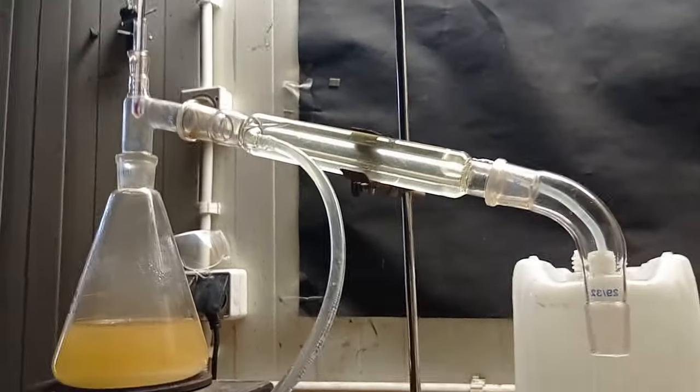Hi there, today I'm going to make nitric acid from commonly available resources.